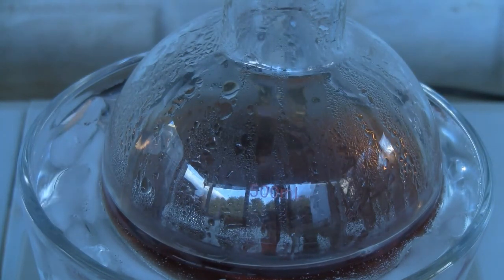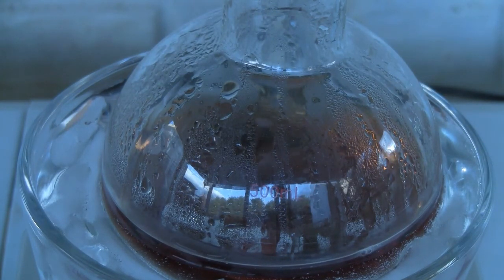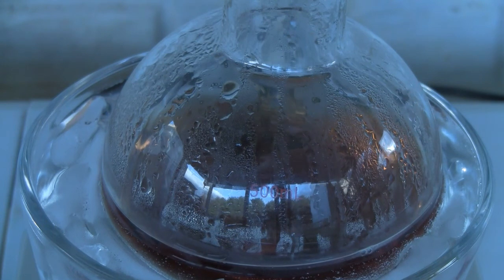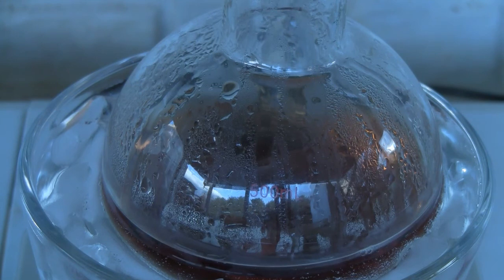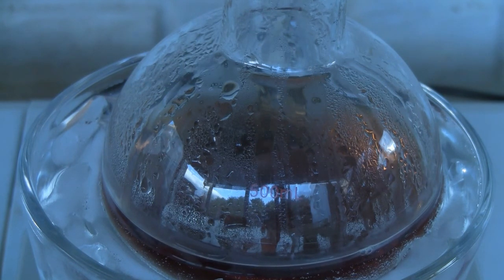The hydrochloric acid is then added slowly until the solution reaches a pH of about 3 to 4. At a pH of about 3.5, the anthranilic acid has a minimal solubility in water, as the carboxylic acid is protonated and the amine is neutral.